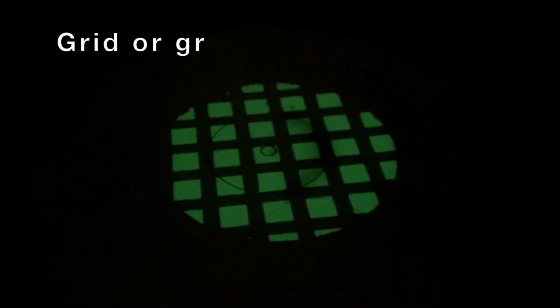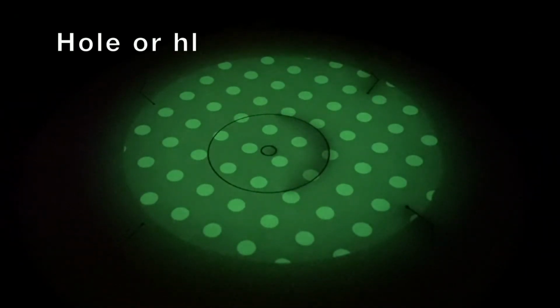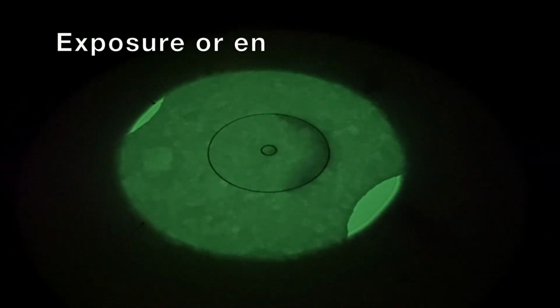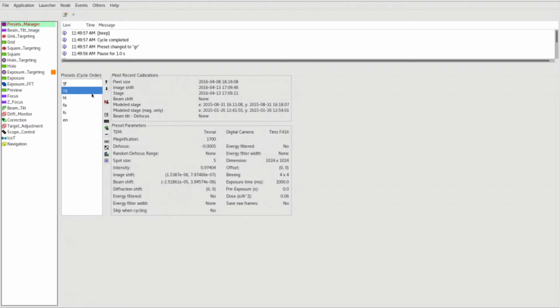With the flu screen down, use the left trackball to center the beam. Repeat for each magnification. This is square. And hole. And EN exposure. Center over a hole. Send square to scope.